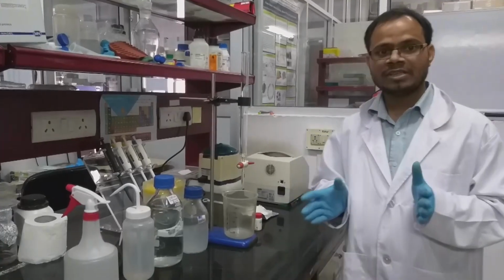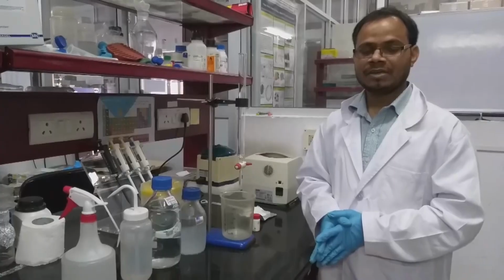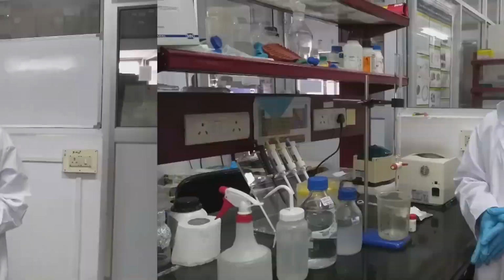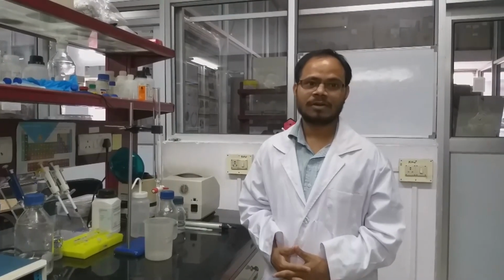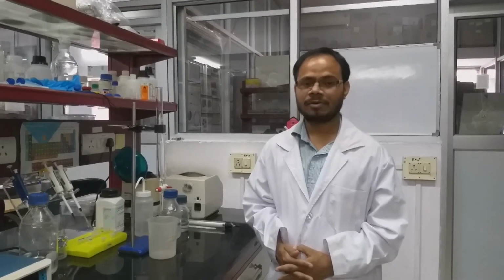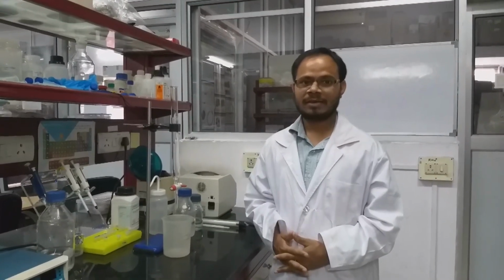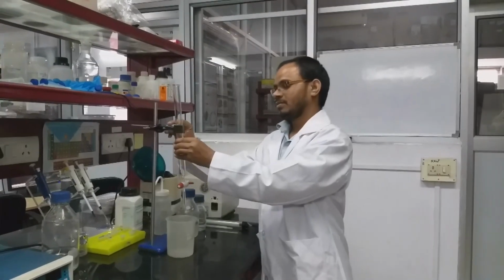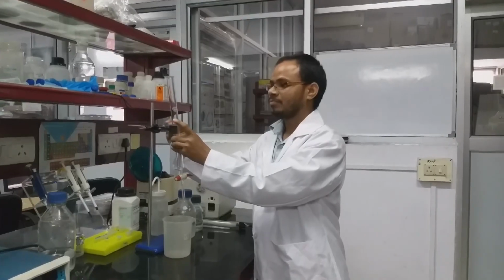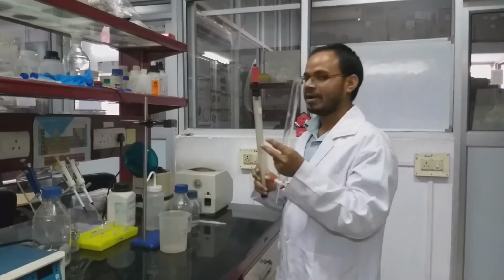In this video we will show you how to pack the column first and what buffers are required. For gel filtration chromatography, there are two kinds of columns available: one is pre-packed columns, and the other is column material which can be used for packing the column. Here we will show you how to pack a column, and also we have a pre-packed column.